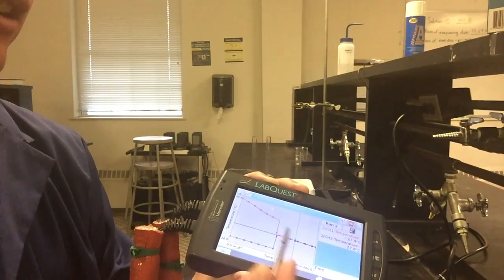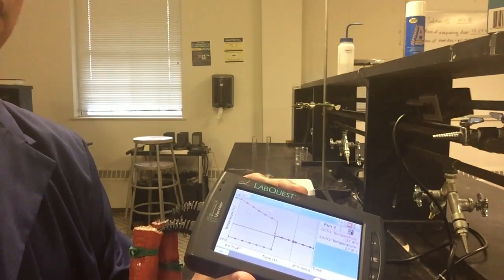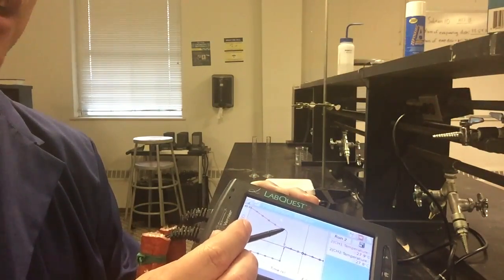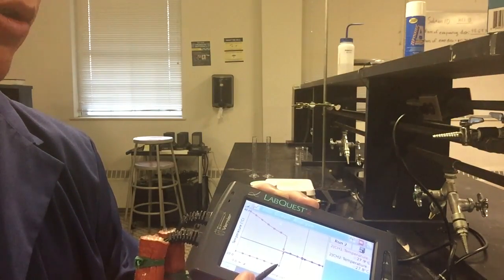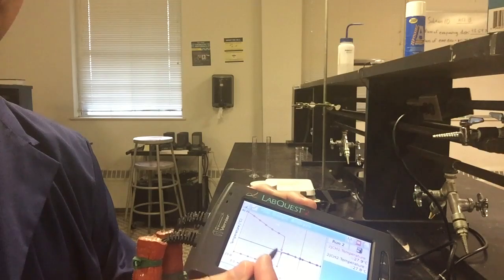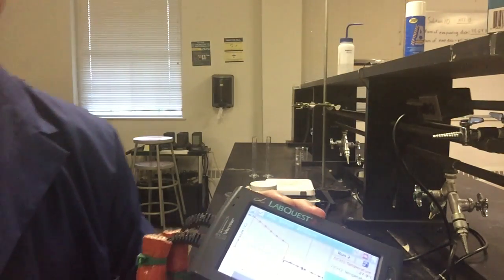The thing I will say as we're looking at this data in particular, when we go to do our actual calculations, like delta T's and things like that, your initial temperature for the hot water should be this last temperature right up here before it drops down, right before you mixed. Same thing with the cold water. You want the temperatures right before mixing, and then for your final temperature, you want what everything came together at here in the middle. It looked like it stayed in that same range for quite a bit.